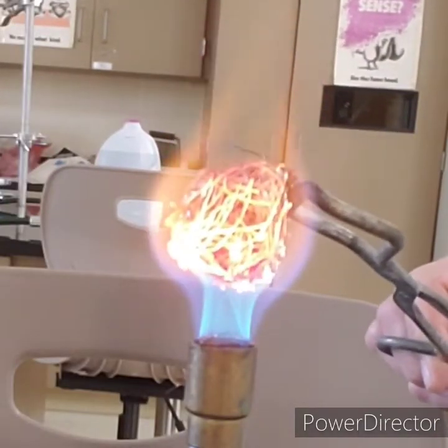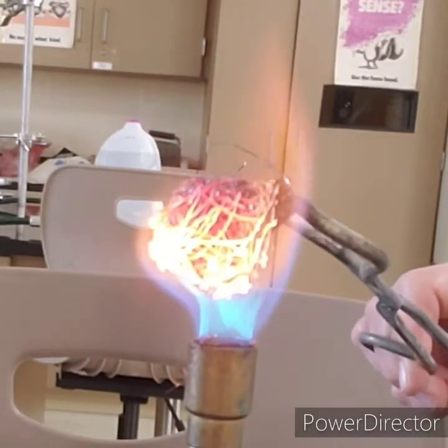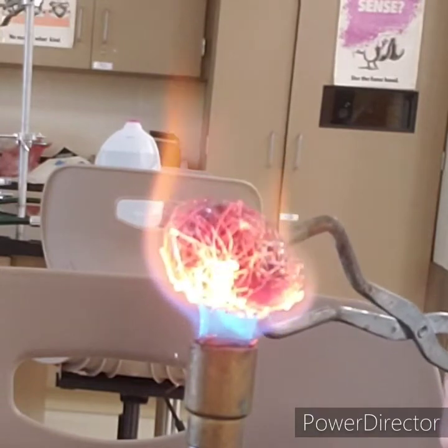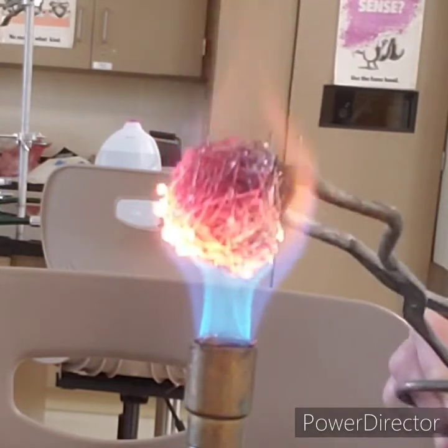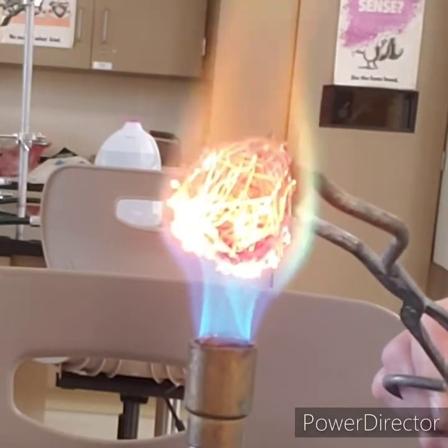You might notice some green flame popping up. That's because green is a signature flame color of copper — that tells you copper is in there somewhere. Notice how it's glowing; that tells you how hot it is.